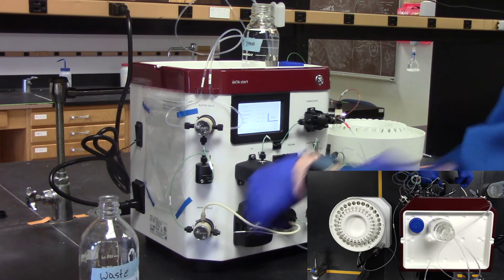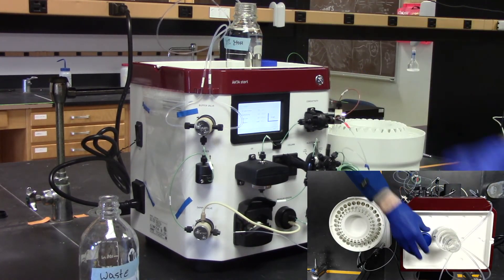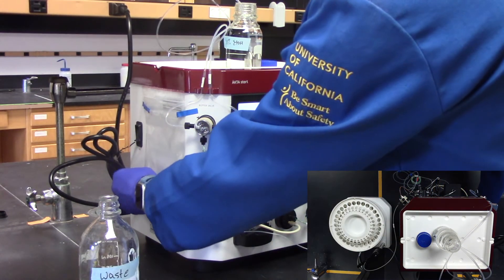The last thing we need to do is unhook the peristaltic pump line and turn off the instrument.